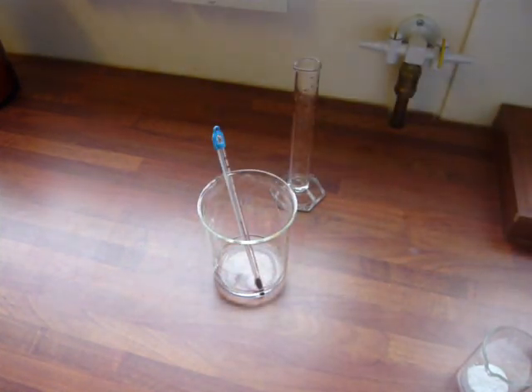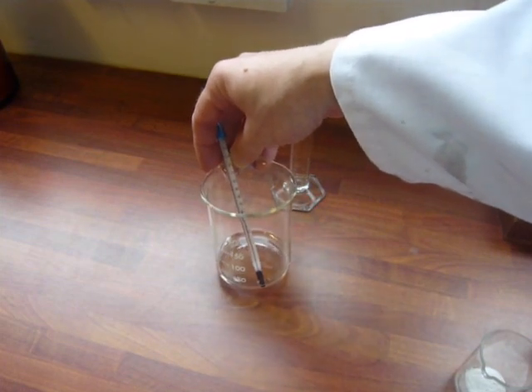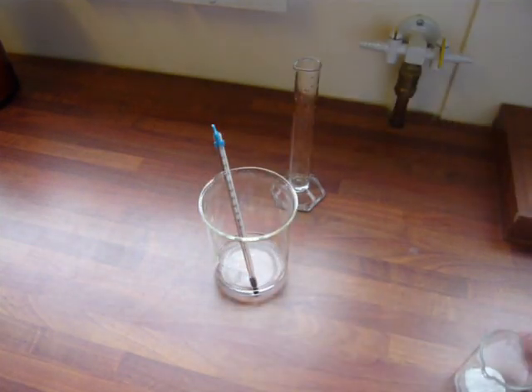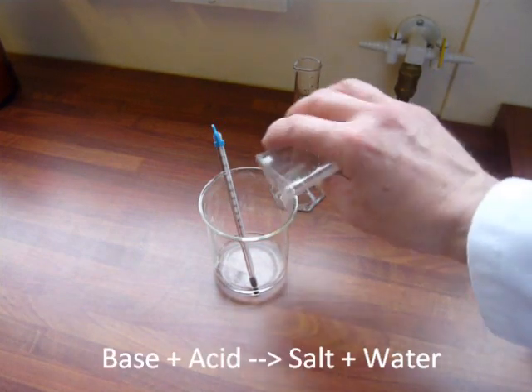I'm going to record its temperature first, then I'm going to add an alkali to it, or a base. Temperature about 21 degrees. I'm adding a weighed amount, 1 gram of calcium hydroxide, tip it in.